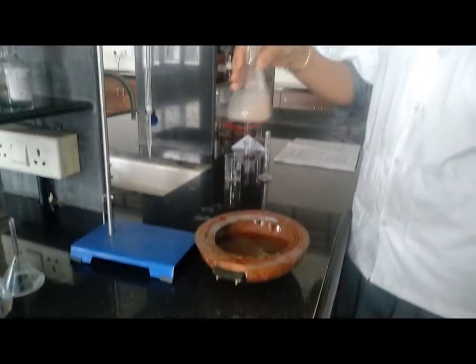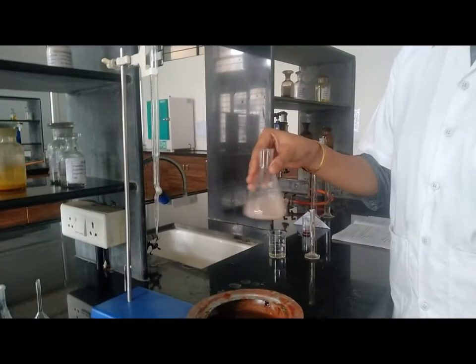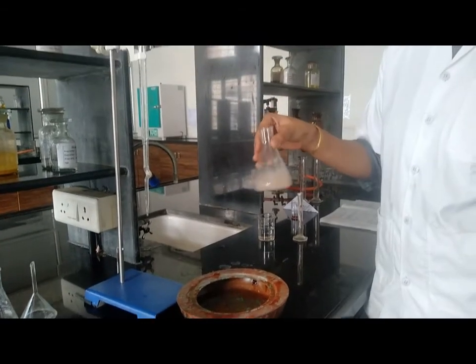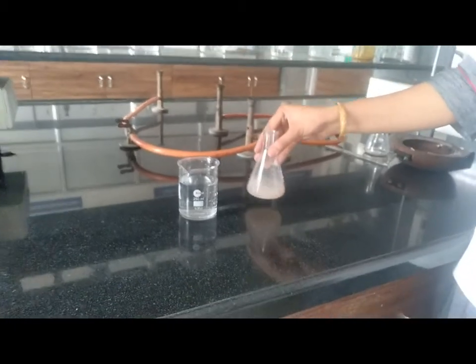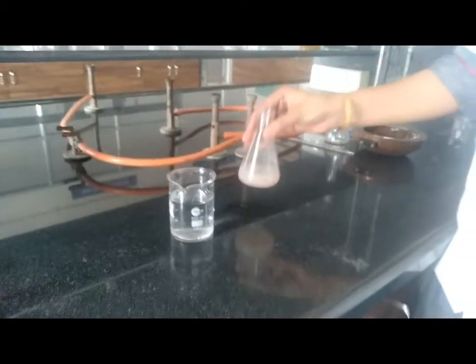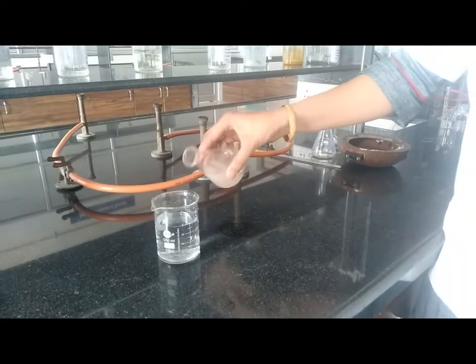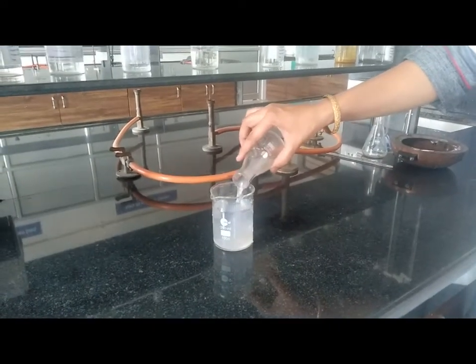This solution is kept aside for 30 minutes at room temperature with occasional stirring, so that the reaction will be completed and we get the final synthesized product. After 30 minutes, this reaction mixture is poured into a beaker which contains 200 ml of water.